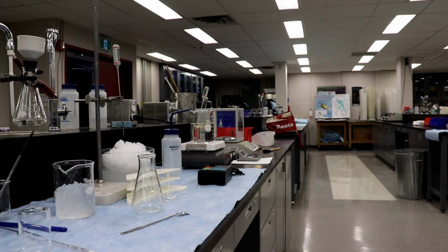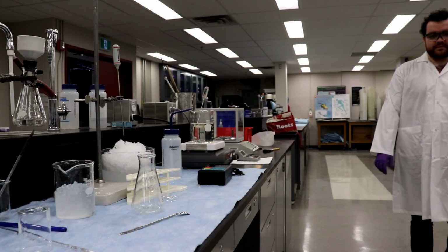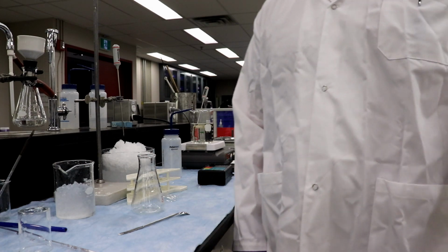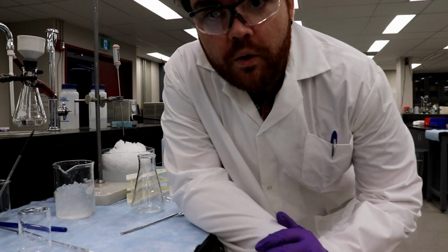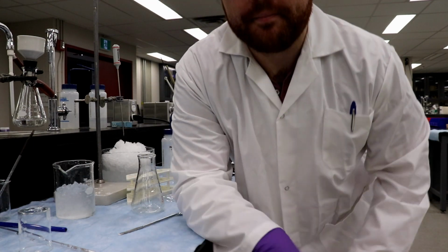Oh, because they probably all have the salicylic acid. The stinkier it is, that means you have more acetic acid kicking around. Right, which means you screwed up. All right, so we're going to dry it for 20 minutes, and we'll come back in a little bit.